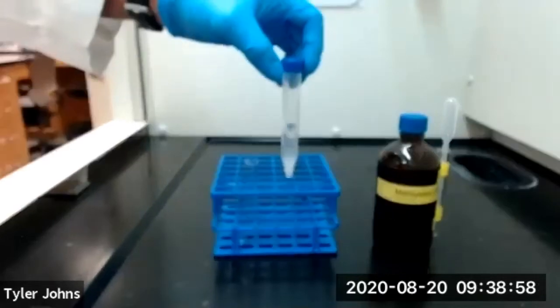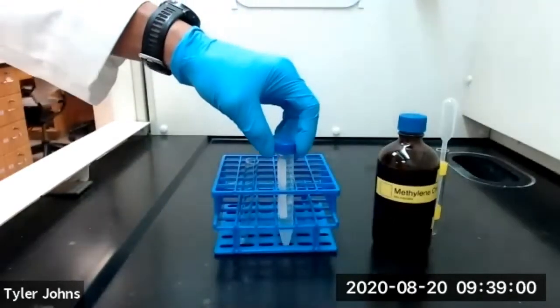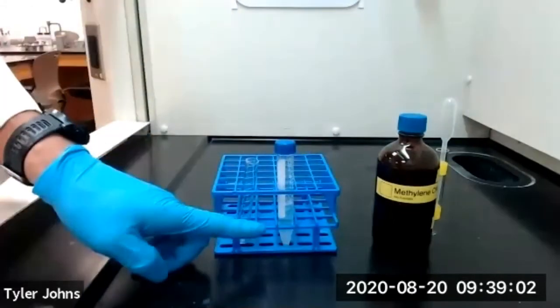Once mixed thoroughly, place your centrifuge tube back in the rack and allow the layers to separate completely.